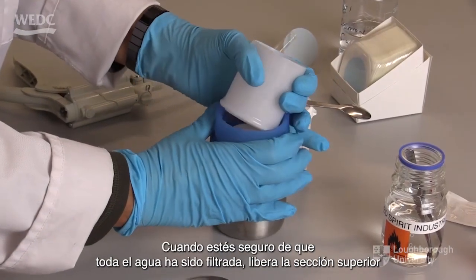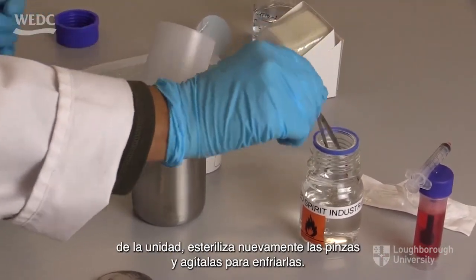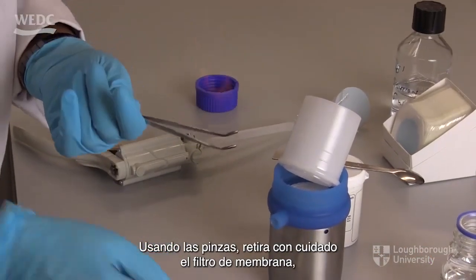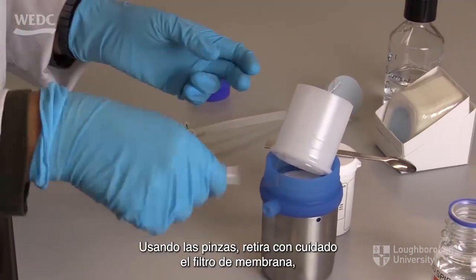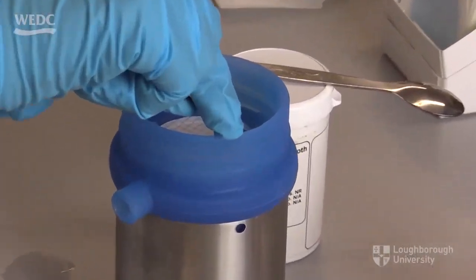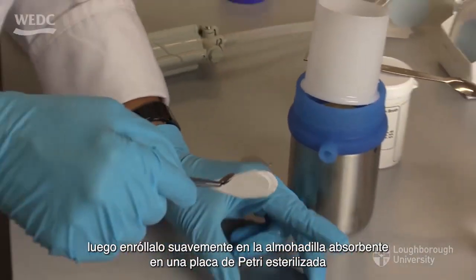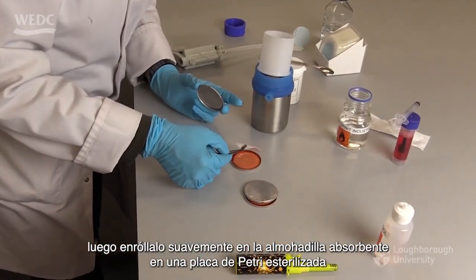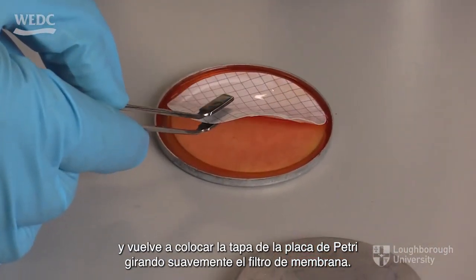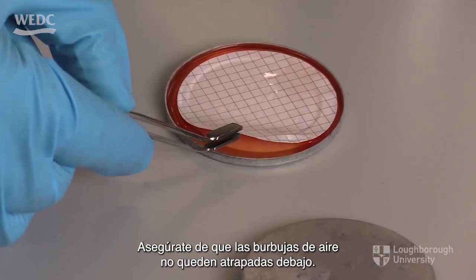When you are sure that all the water has been filtered, release the top section of the unit, sterilise the forceps again and shake them to cool them down. Using the forceps, carefully remove the membrane filter, then roll it gently onto the absorbent pad in a sterilised petri dish and replace the petri dish lid. Rolling the membrane filter gently ensures that air bubbles do not get trapped underneath it.